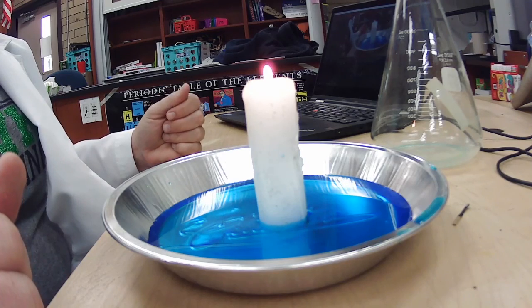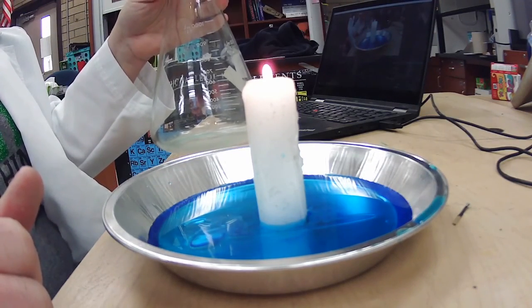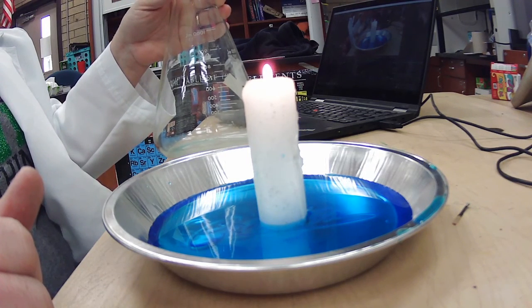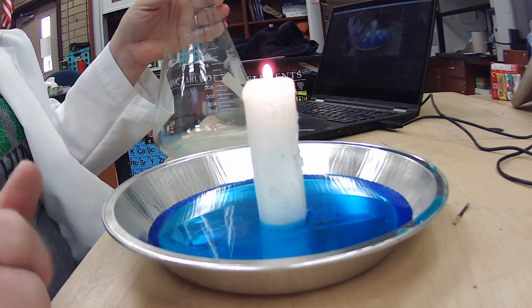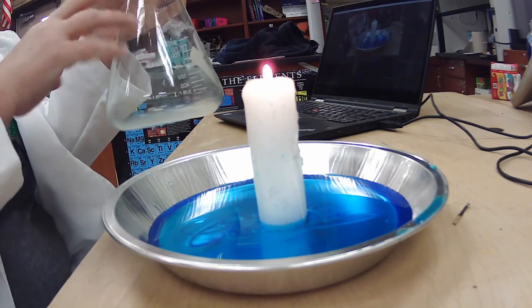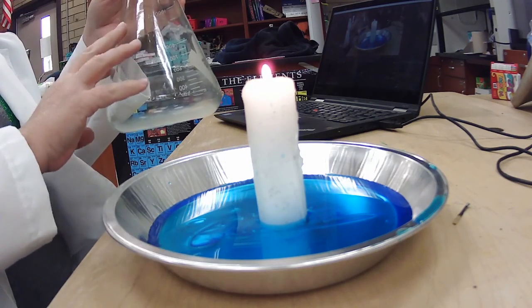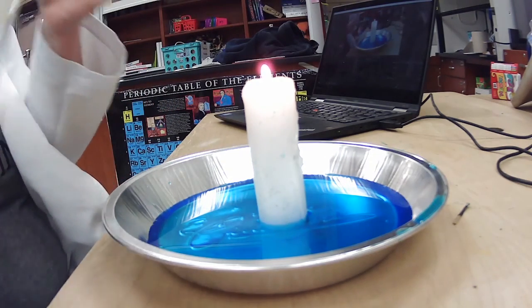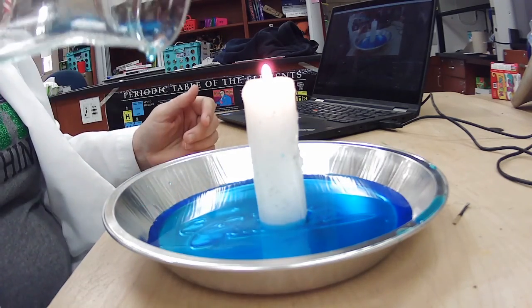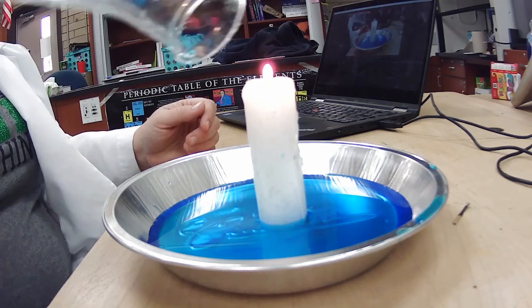All right, so now what we're going to do is take our flask, and once it gets nice and warm, we're going to turn it over. Remember, there's air inside this flask, right? Air is always moving, constantly colliding. It's always diffusing into here. So we've got a good amount of air in there, a good amount of gas. I'm going to make sure I don't have any liquid in here from when I was playing with it earlier. All right, here we go. So let's see what happens.